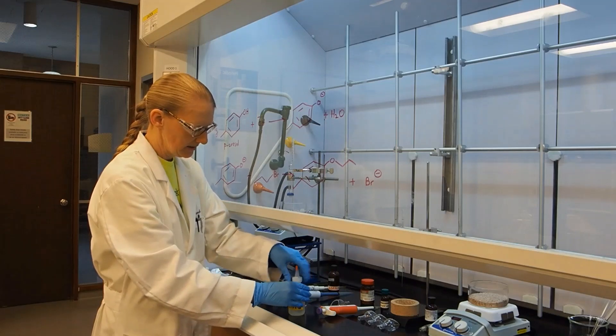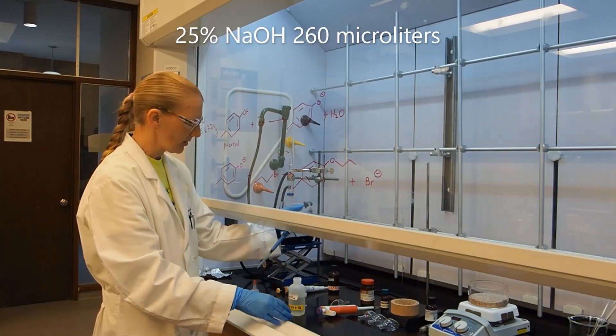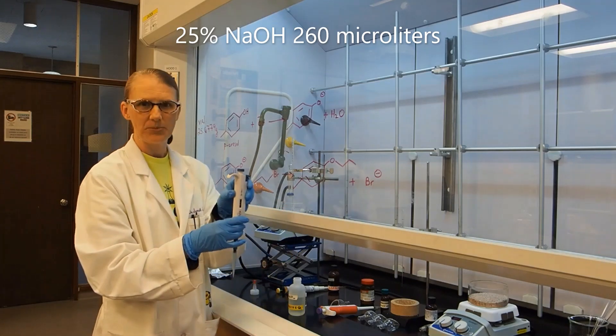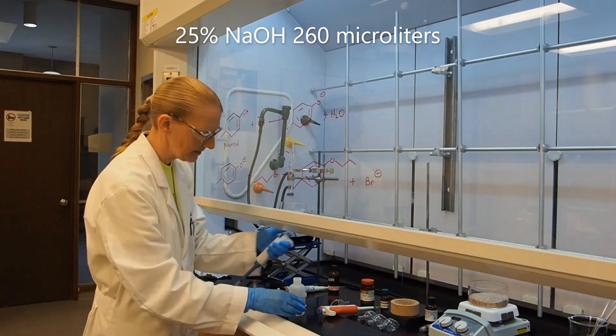The next reagent is going to be our solvent and our base. I've already preset my automatic pipette to 260 microliters.